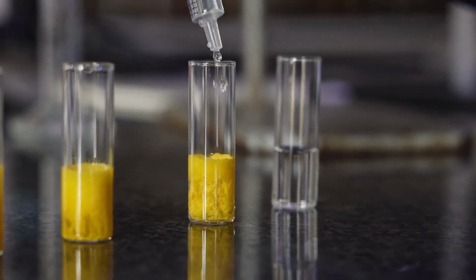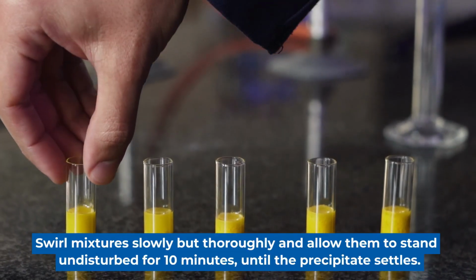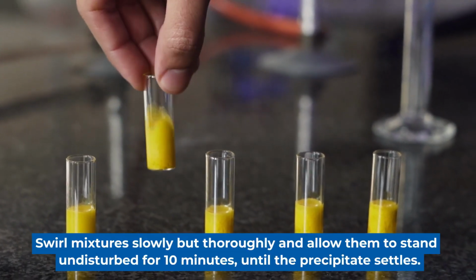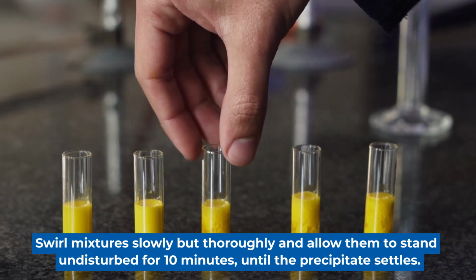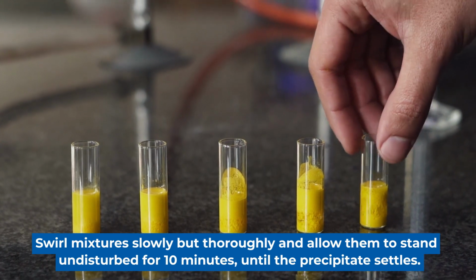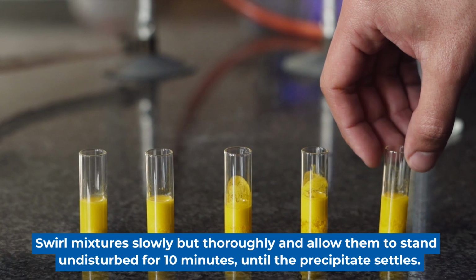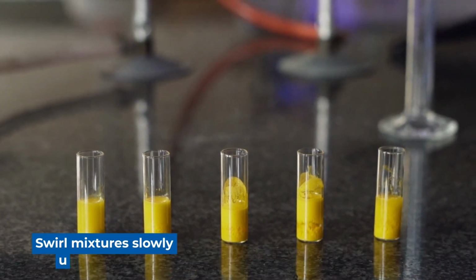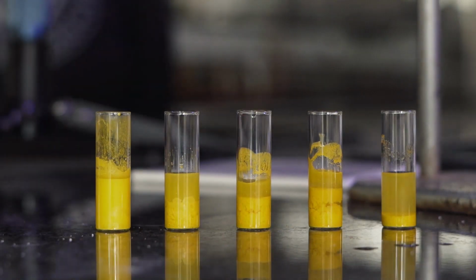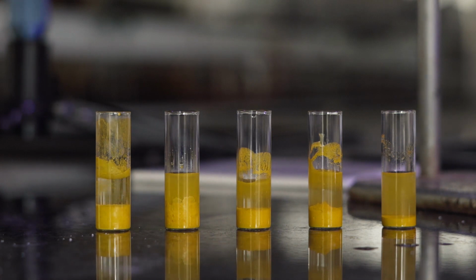Once all of the vials have been made up to 3 cubic centimeters, we need to swirl all of them to make sure that all of the lead, nitrate, potassium and iodide ions can react with one another. Once swirled, the vials need to be left to stand so that the precipitate can settle at the bottom of the vial, as we need to measure the height of the precipitate in every vial.